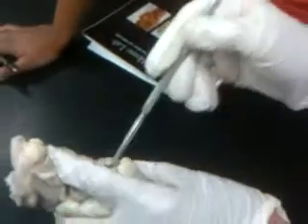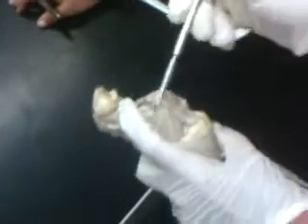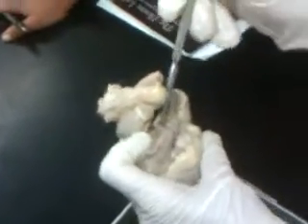And this will be? Pulmonary trunk? And then coming close to the back, you're going to see the inferior vena cava. The veins are very closely cut. Right here. That's basically the main part.